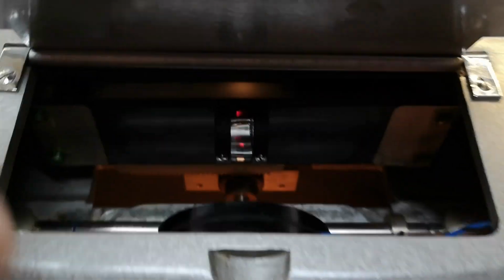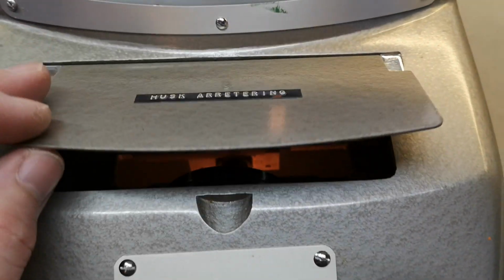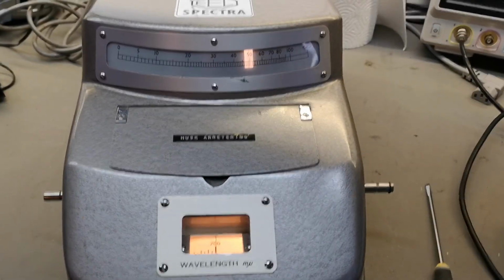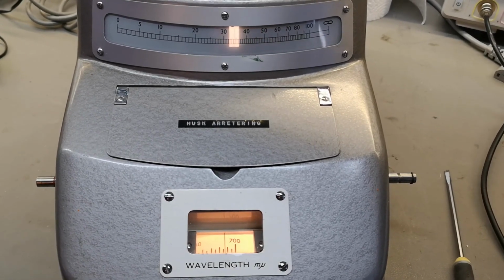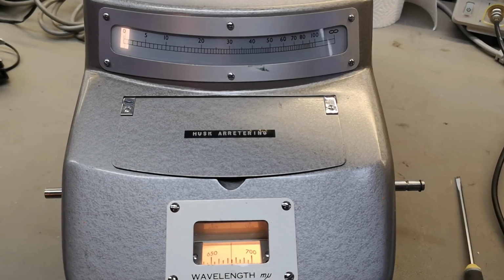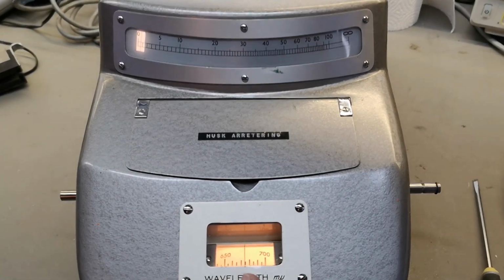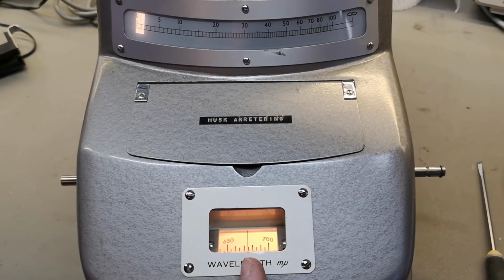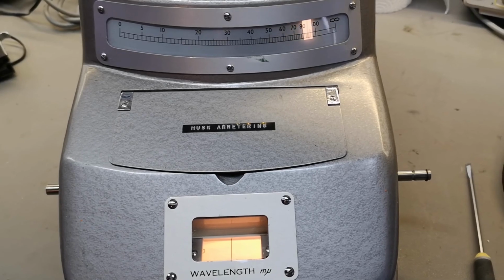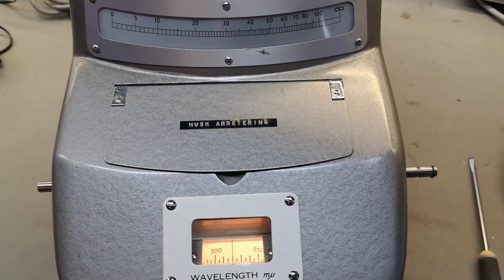So I don't have anything in it at the moment. So what we're reading now is the response of the unit itself, right? It's still a little bit dim in here because I don't want any false light to trigger anything. Let's see if I can show you guys this. So this is 700, and then see what happens. Let's go down. So at 675, I overdrive because of sensitivity. So that means this is my maximum sensitivity range from 675. And see, it drops quite a lot of sensitivity from 700. And if I even go more than 700, see.